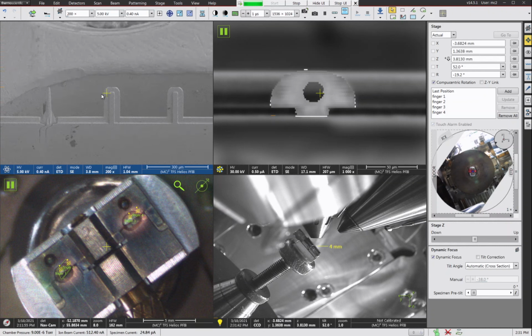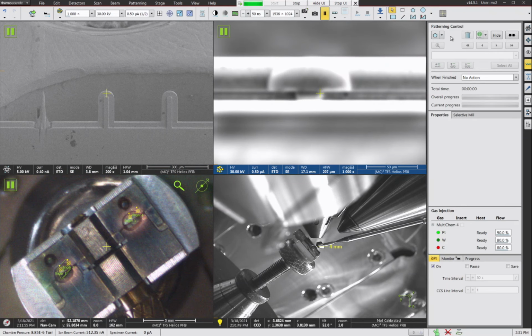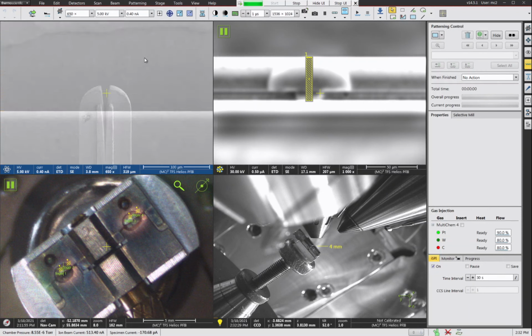So what I like to do for this grid is go to the second finger here, and I'm just going to simply put a rectangle pattern right down the middle of the grid and cut it about 10 microns deep. It doesn't have to be very deep. You'll see it in the atom probe, no problem. And we'll cut this. Now let's take a look at what we have. And you see now I've got this notch in the second grid finger.